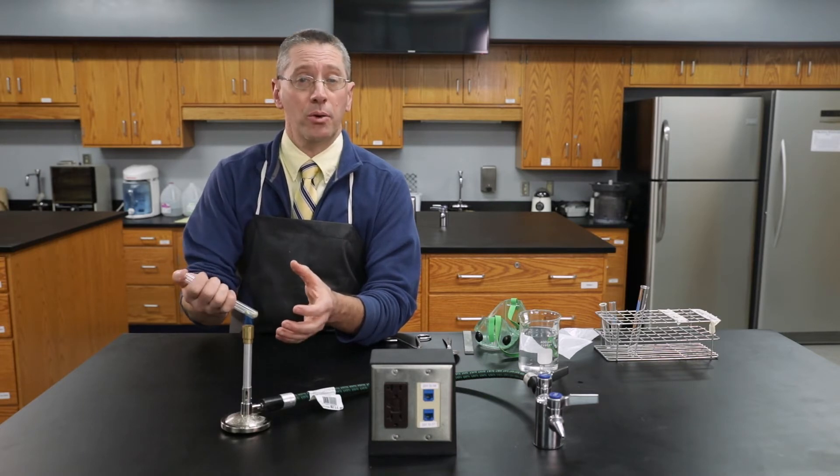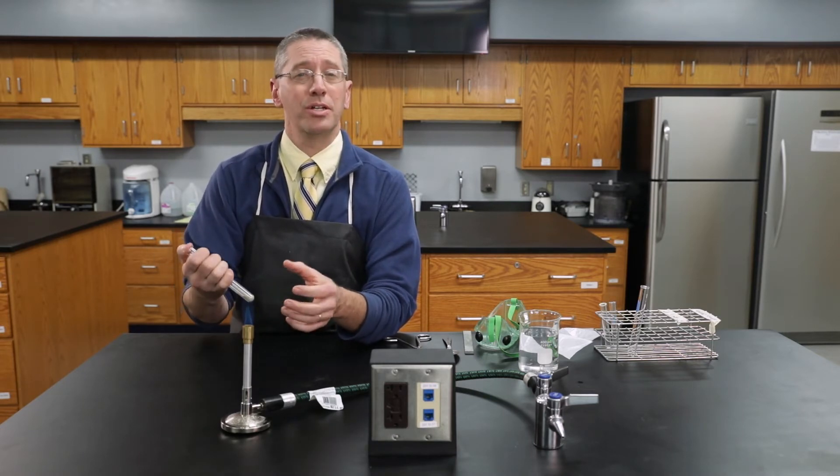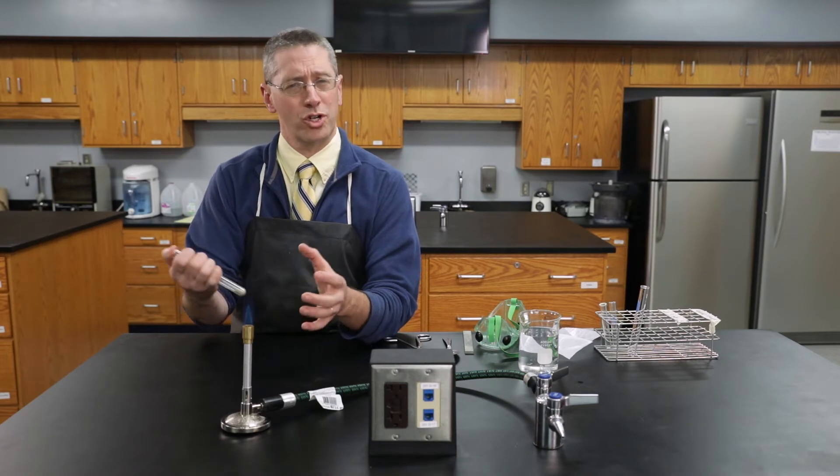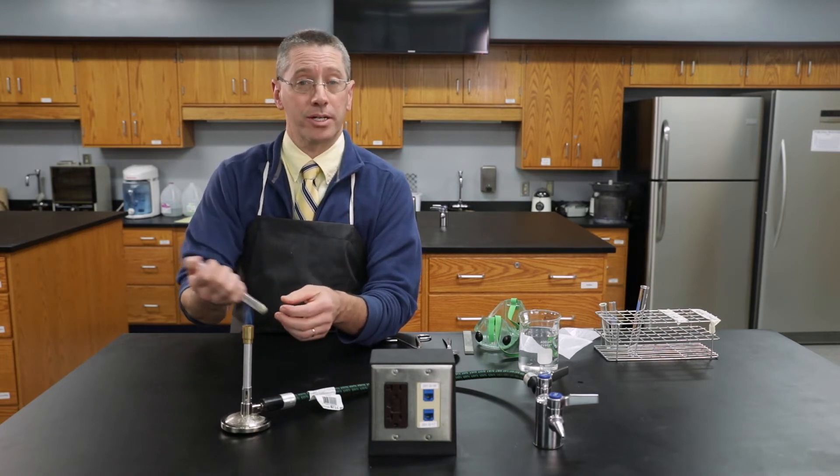To retrieve the product we're going to have to take that hot test tube and plunge it into a beaker of cold water which will shatter the test tube and then we can scoop the product out.